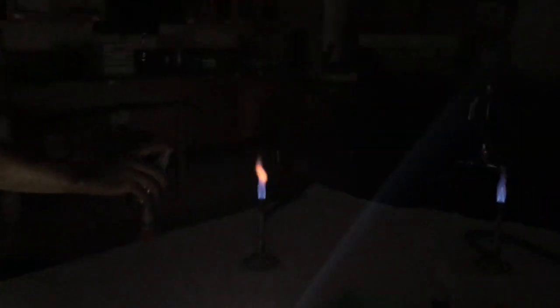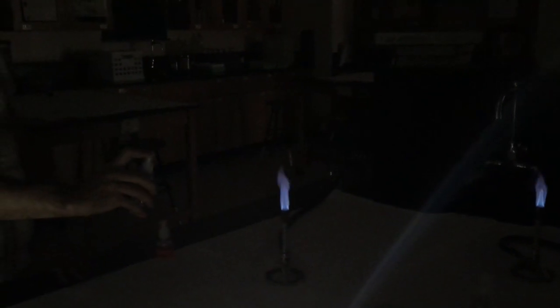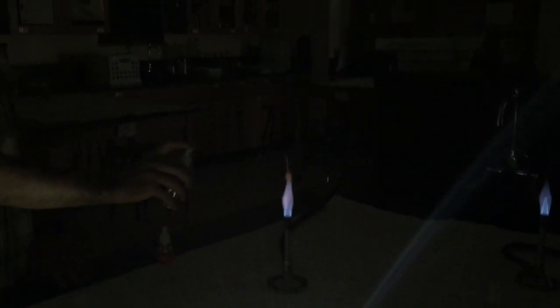We do. All right, I have the KCl here. Looks like the flame's back to blue. So this is why we keep the lights out, because this one is hard to see, but I could definitely see a little change. Purple in there.